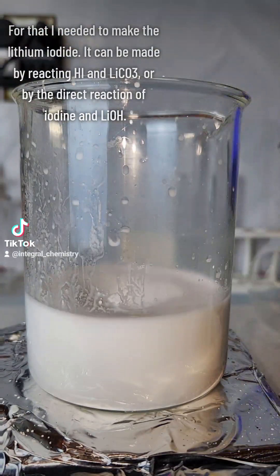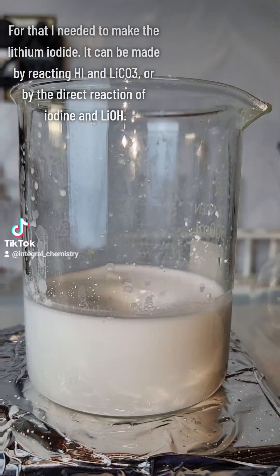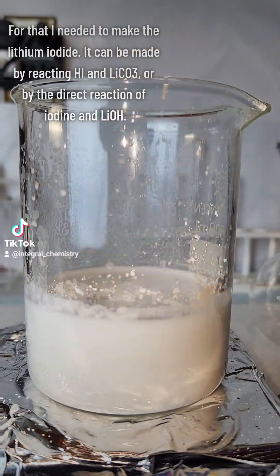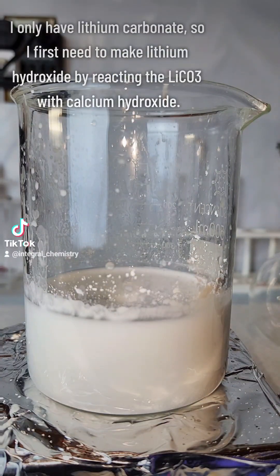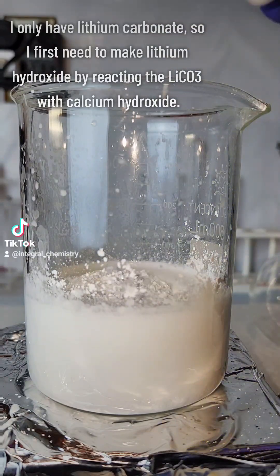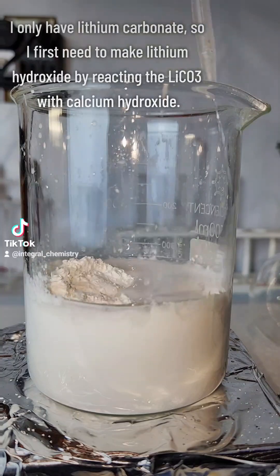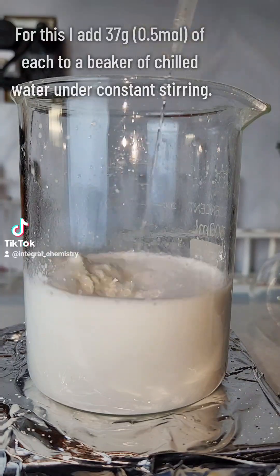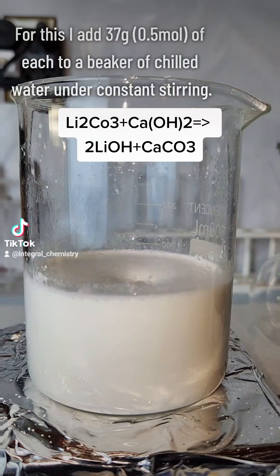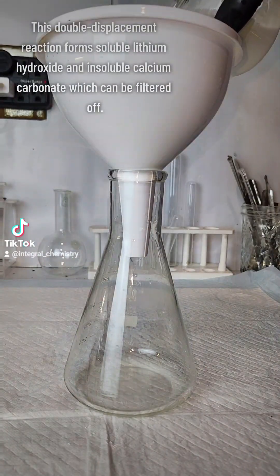For this to work, I needed to make the lithium iodide since it's not really something you can buy. The obvious route is to react hydroiodic acid with lithium carbonate, but I feel like I'd get in trouble for making hydroiodic acid on here, so I looked for something else. What I found is that lithium iodide can also be made by the direct reaction between lithium hydroxide and elemental iodine. The only issue is I don't have lithium hydroxide either, so I first need to make it by reacting lithium carbonate with calcium hydroxide.